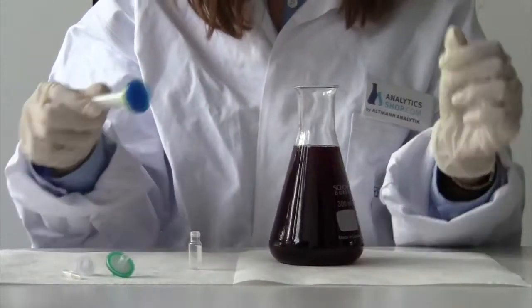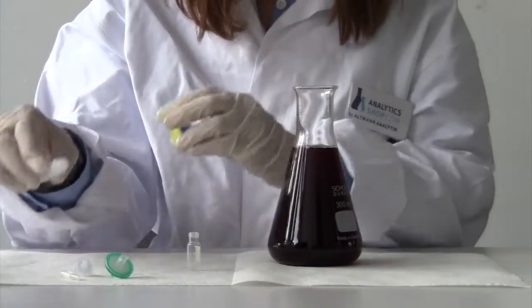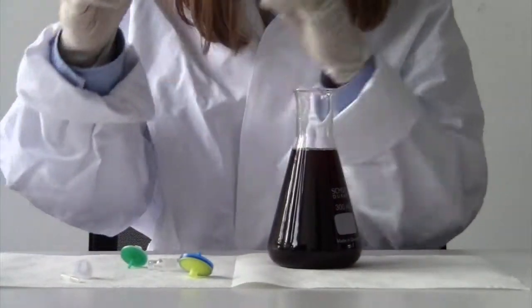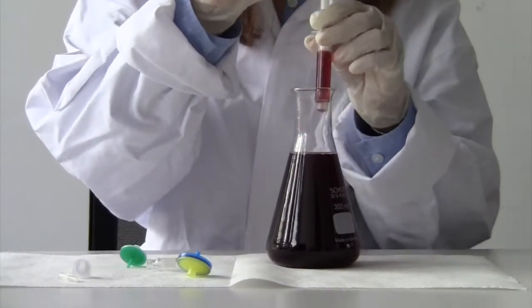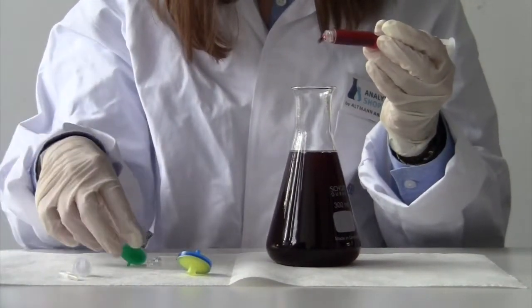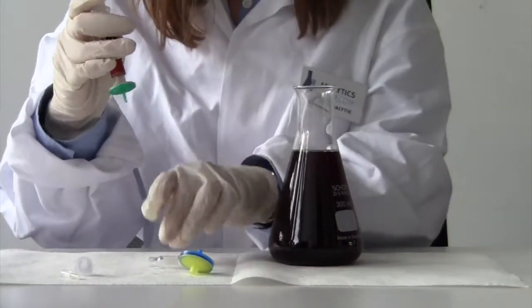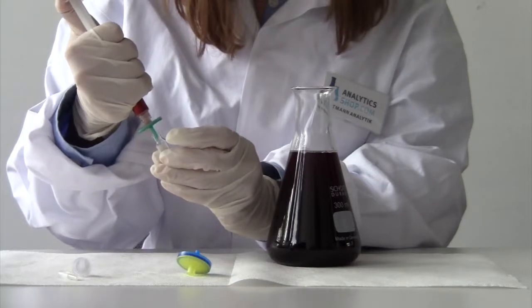In general, the handling is quite simple. At first you have to draw up the liquid into the syringe, then the syringe filter is put on, and the sample is poured into a vessel or vial.